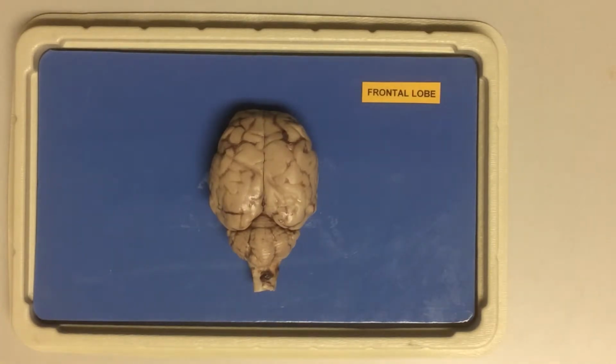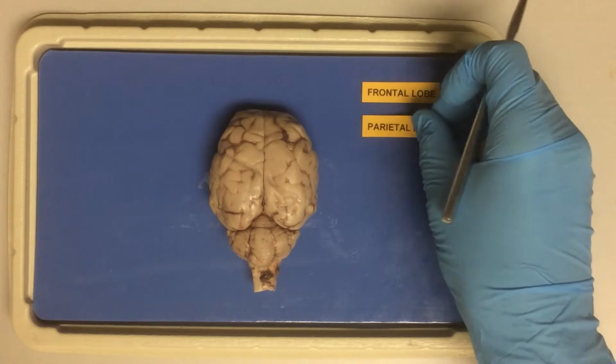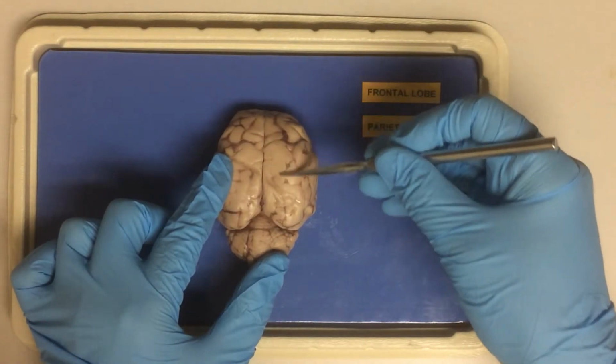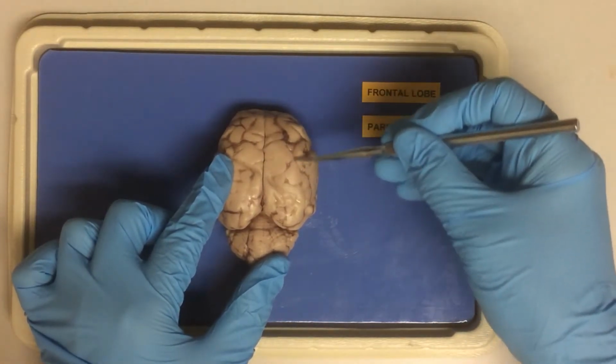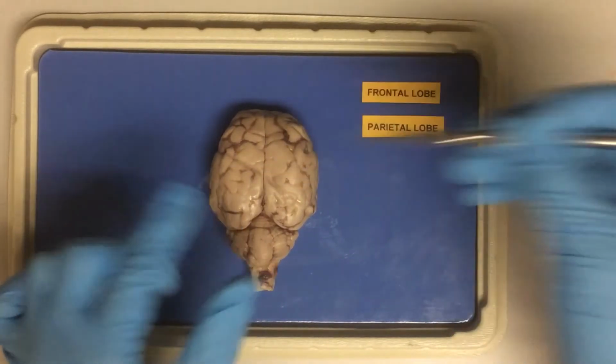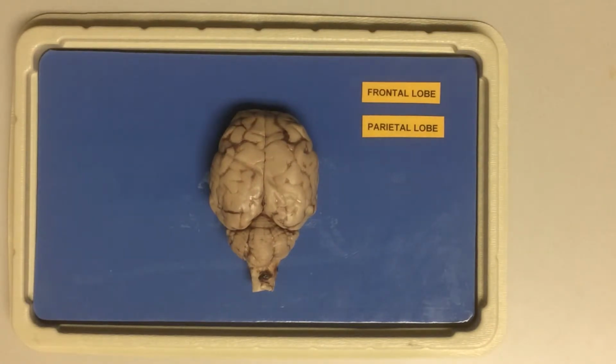So in the sheep, this is a little smaller than in the humans. Sheep are not known for their amazing personalities or making a lot of long-term plans for the future. Now next, let's look at the parietal lobe. In the sheep, this is large. This is where the primary sensory area is located. So processing the location of the body, for example. So this would be pretty important for the sheep, right? So this is an area that is relatively larger in sheep.